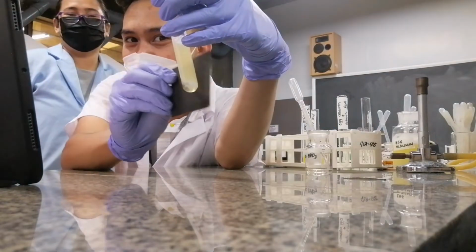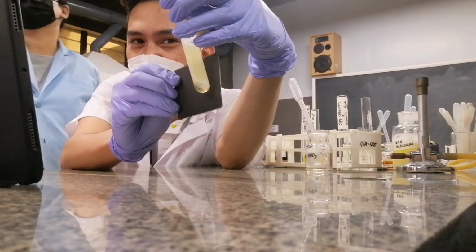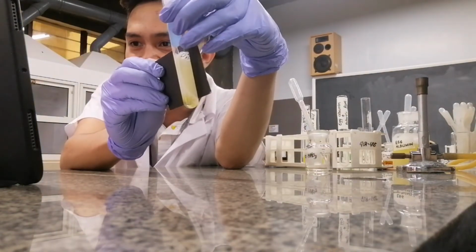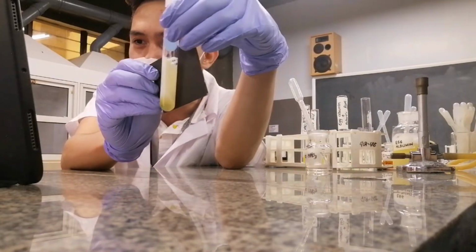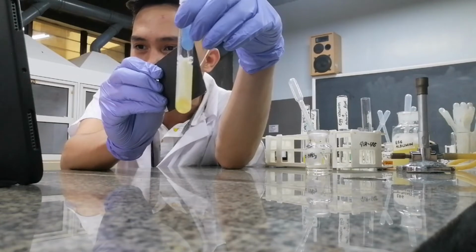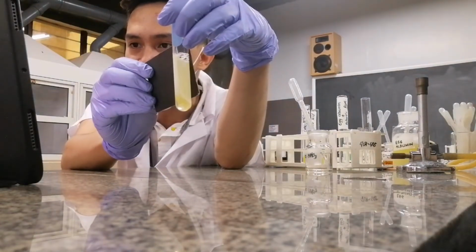But nonetheless, what did you notice? Upon the addition of the nitric acid, what was formed? It formed a white substance, a white precipitate. Do you follow? That's the effect of your Heller's test or Heller's ring.